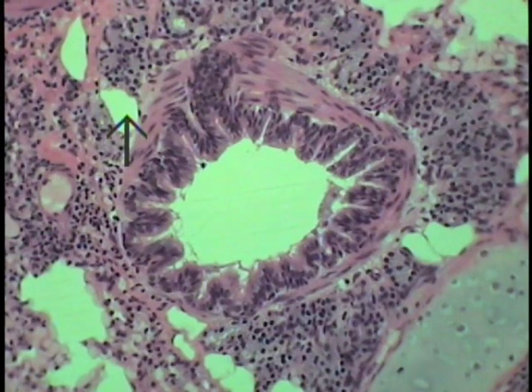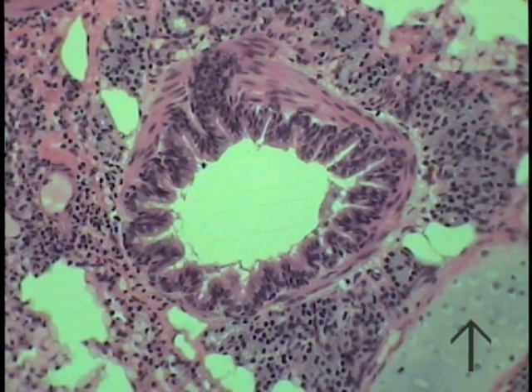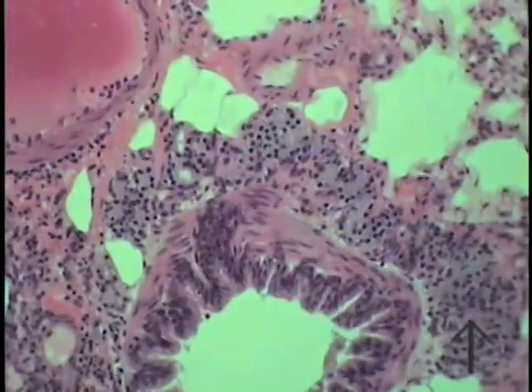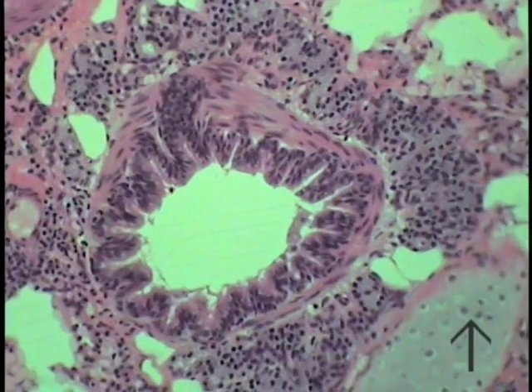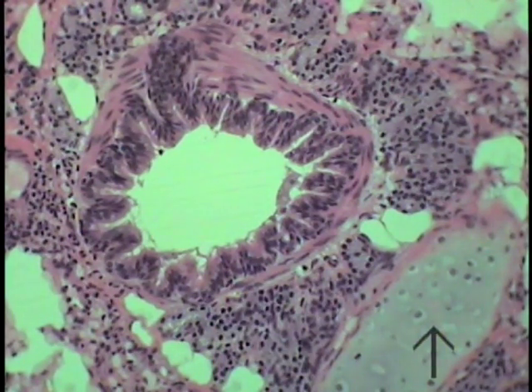This represents a section through the tertiary bronchus, that smallest subdivision of this dividing conducting portion that still retains its cartilage. So this would be an example of a tertiary intrapulmonary bronchus. Note that the features are still present, but what makes it still a bronchus is the retention of the hyaline cartilage plates, which will disappear beyond this particular point.